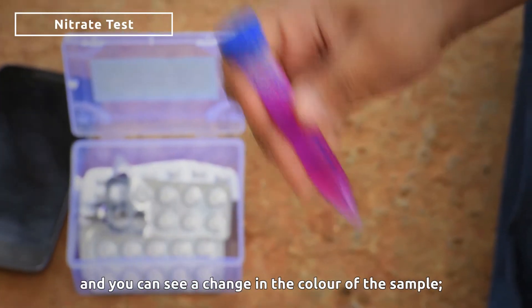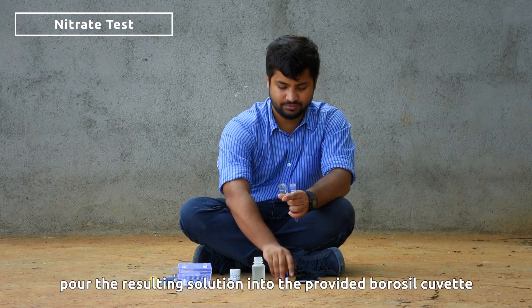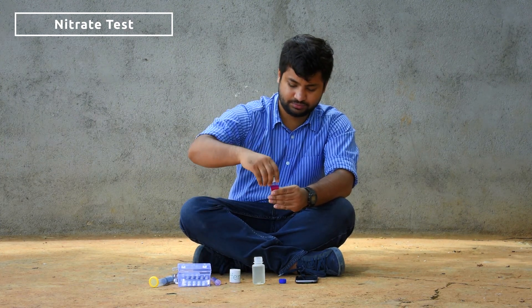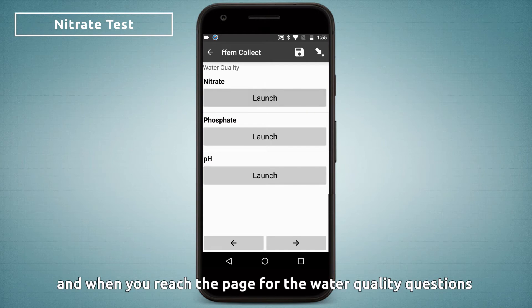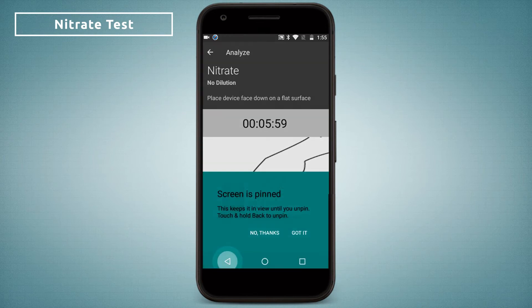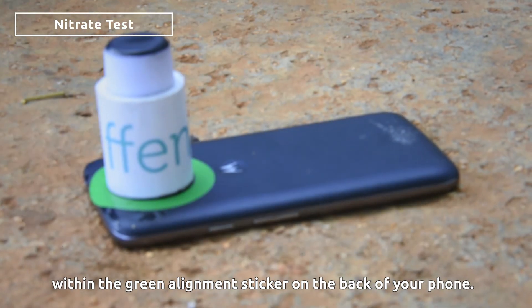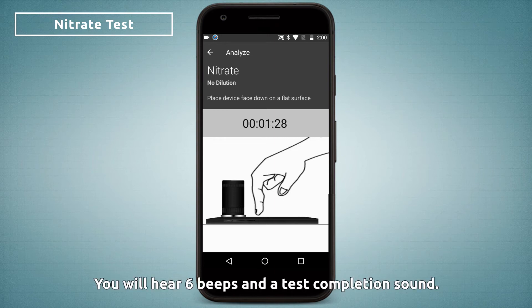Once the two tablets have completely dissolved, you will see a change in the color of the sample. Pour the resulting solution into the provided borosil cuvette and close the lid. Place the borosil cuvette into the provided pipe. When you reach the page for the water quality questions, launch the test for nitrate. Put your phone face down and place the pipe and cuvette combination within the green alignment sticker on the back of your phone. The test will take about 6 minutes to complete. You will hear 6 beeps and a test completion sound.